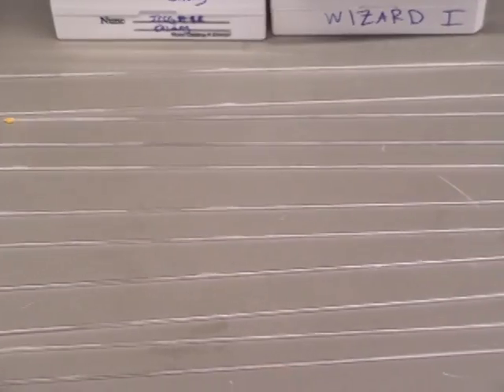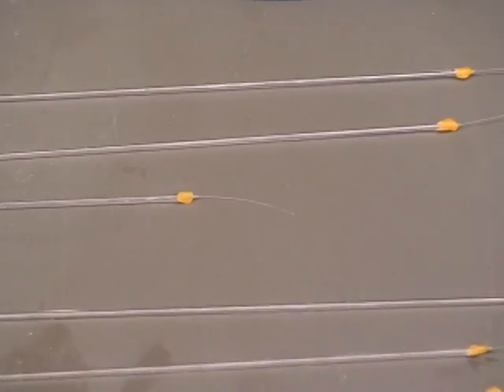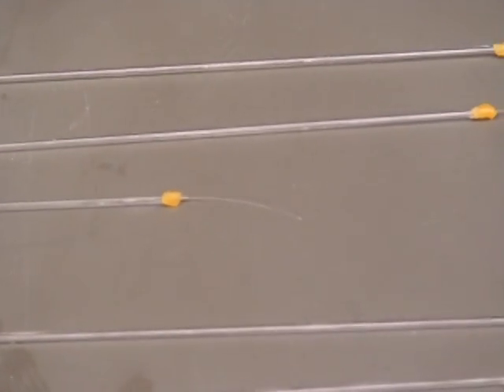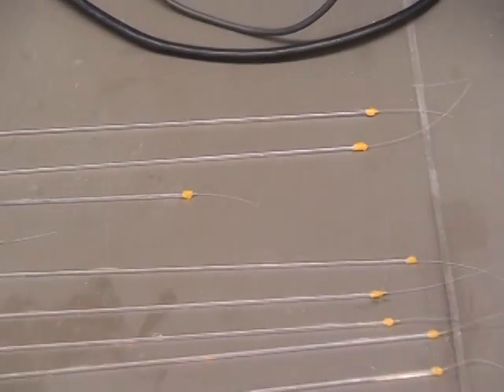You can see that the tubes are fairly long, maybe a little bit less than a meter. And at the other end, we have the small Teflon tubing coming out the end, so once the tubing is filled, that end will be sealed.